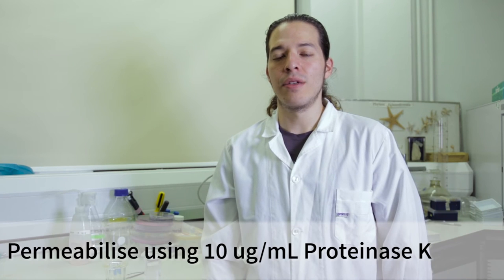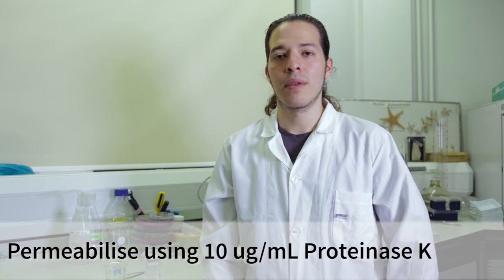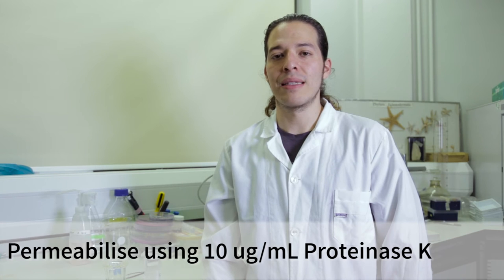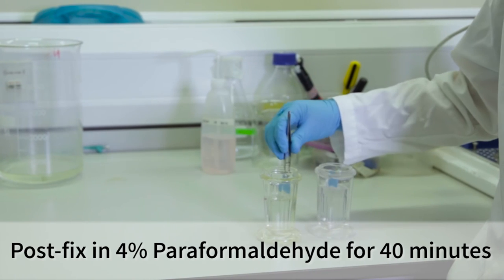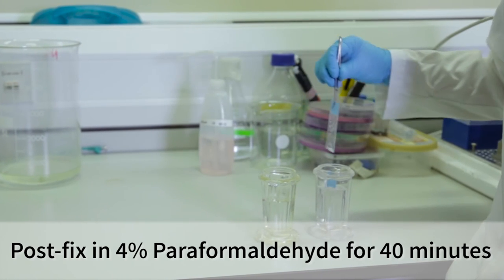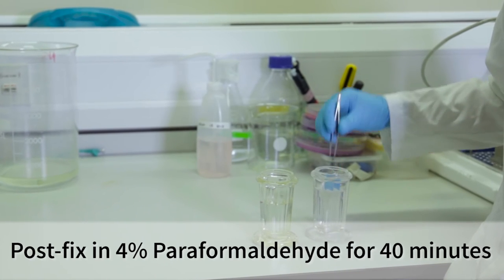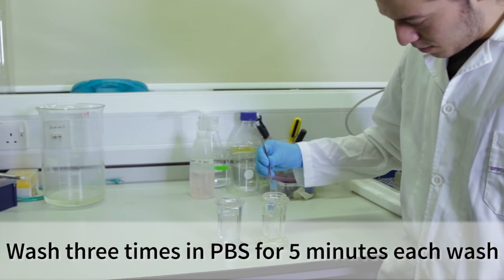We will permeabilize it using proteinase K. It is crucial to optimize this step as weak proteinase treatment will decrease the signal of your mRNA, while using excessive amounts of proteinase K may degrade your tissue. Now, I will post-fix the slides using 4% paraformaldehyde. This treatment will help us to preserve the tissue after the proteinase K treatment. We will post-fix for 40 minutes.